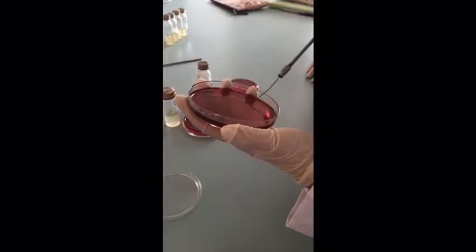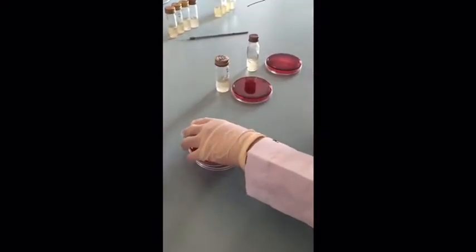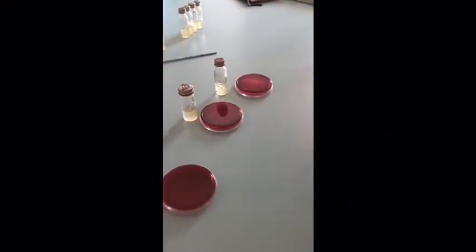And we will perform the streak plate method on the EMB culture. We will also be doing the same procedure for the following 2 samples, that is 0.1 ml as well as the 1 ml sample. After we have done all the streak plates, next we will incubate all the plate cultures in an inverted position for 24 hours at 37 degrees Celsius.